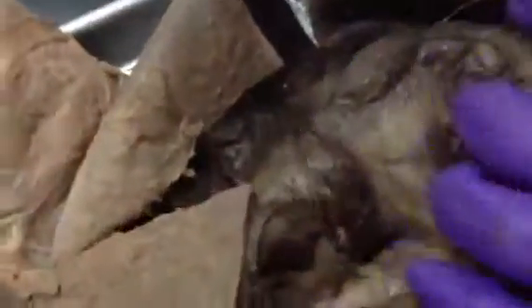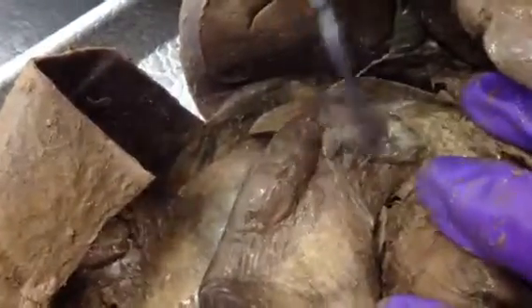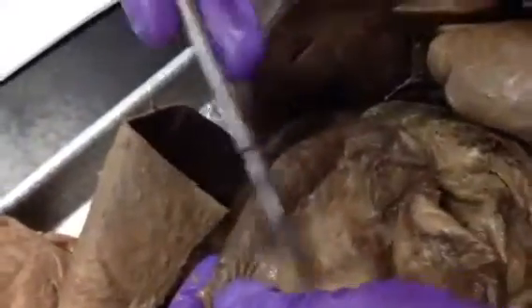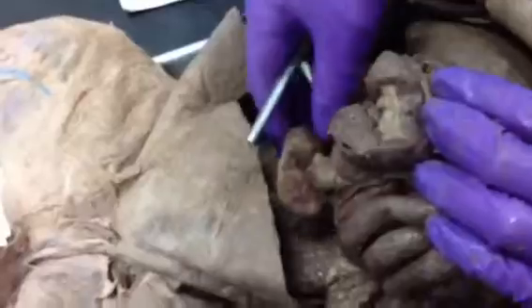And the first little curve that you have of the small intestine is the duodenum. Inside of the duodenum, or in the mesentery of the duodenum, you have the head of the pancreas. And the tail keeps going underneath here towards the spleen. This mesentery on the duodenum is the mesoduodenum. And then you follow the duodenum and you get this big bundle, and that is the jejunum-ileum. The more cranial part of it is the jejunum, and the caudal part is the ileum.